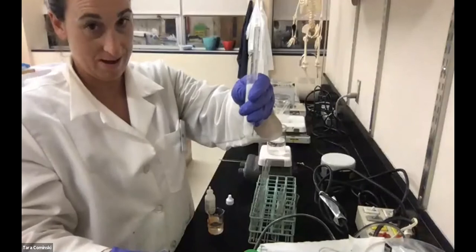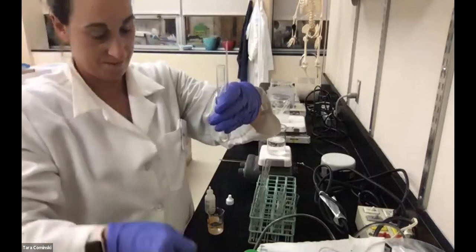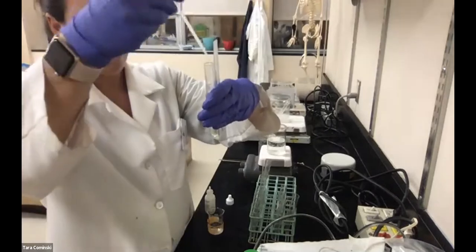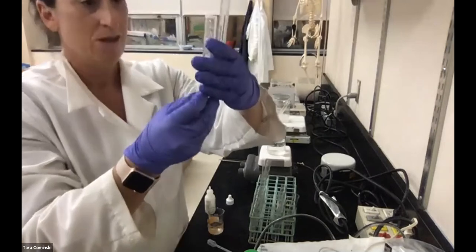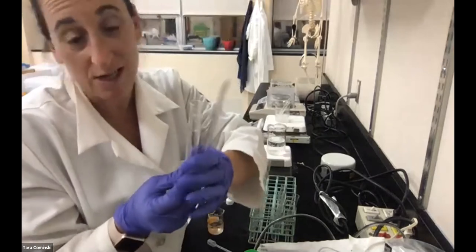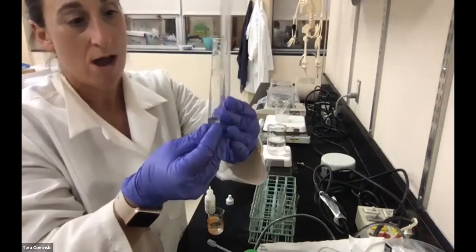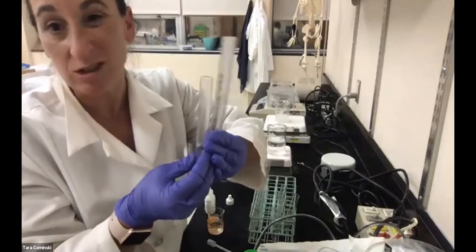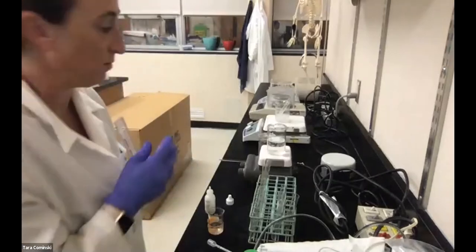1, 2, 3. All right, so for this one, it's about the same. So I would say this is probably 50. Let's call this the 37 degree one. I think it's about 50 millimeters, about the same. So the bubble height was about 50 millimeters, same as the other one. There wasn't really much difference.